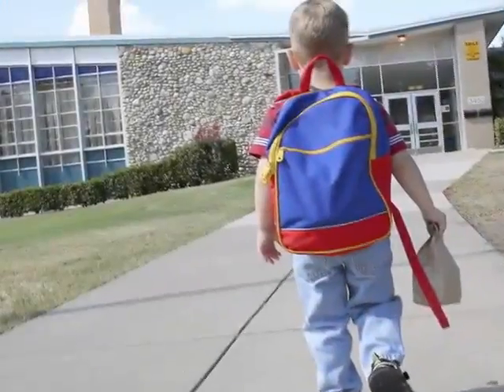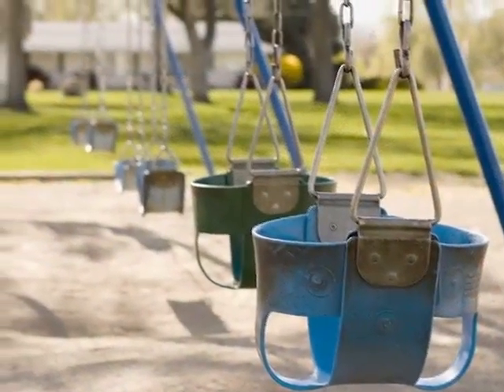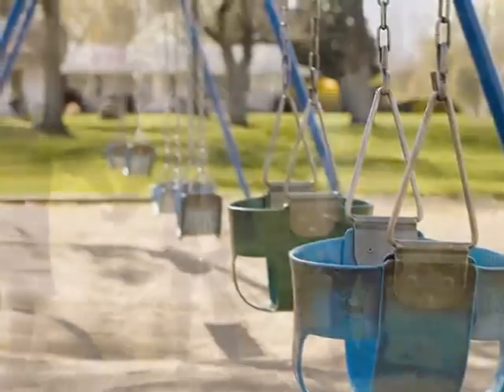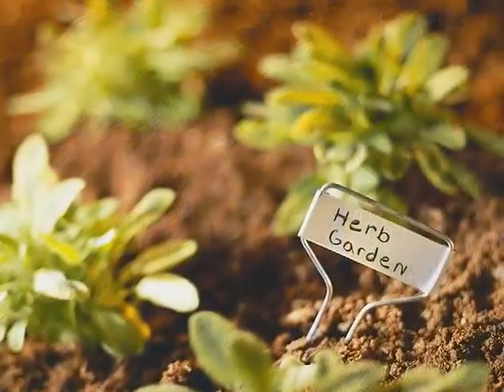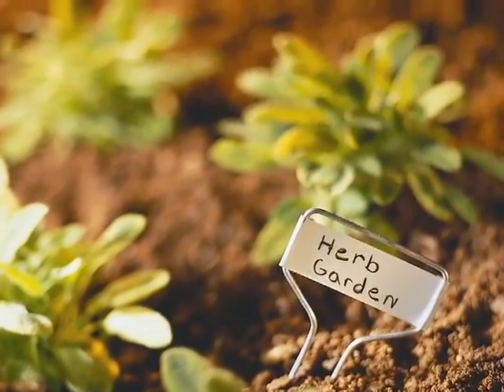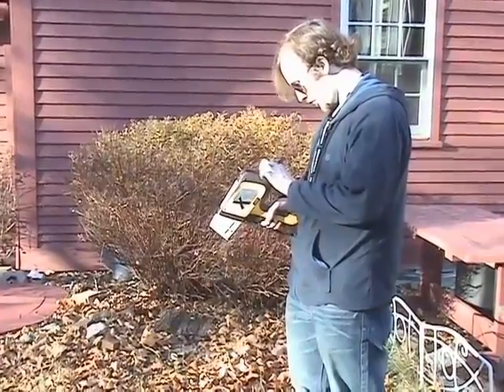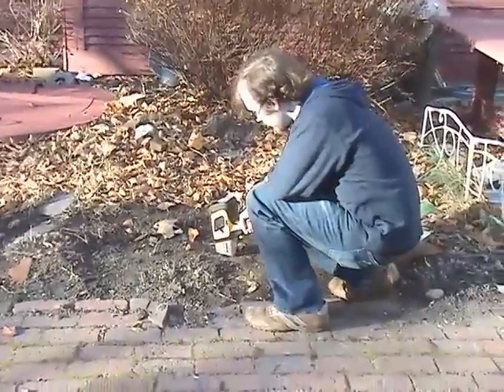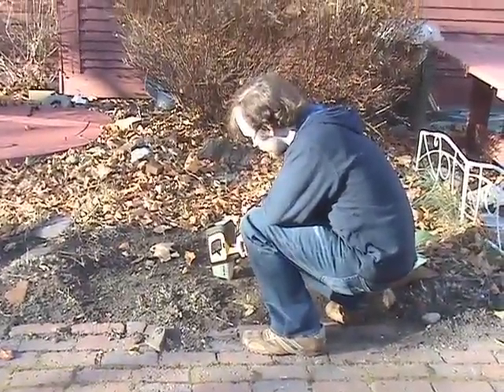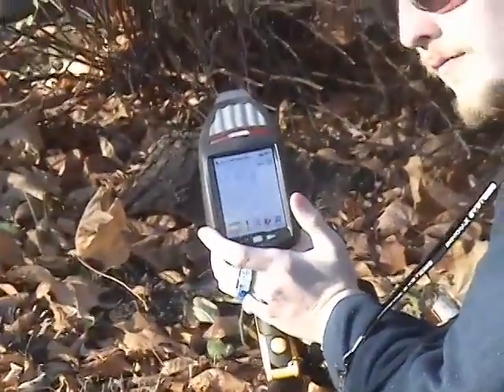In conclusion, it's important to know if the surrounding soil of a community or residential property has potentially dangerous levels of lead or other toxic metals. This is of particular concern if children play on the ground or if vegetables, herbs, or other edibles are grown in the soil. Handheld XRF is an ideal tool for quickly screening the soil for these toxic metals. Simply place the analyzer window on the soil, press the trigger, and read the display. Test results seen in seconds help to determine the next course of action if caution or remediation is necessary.